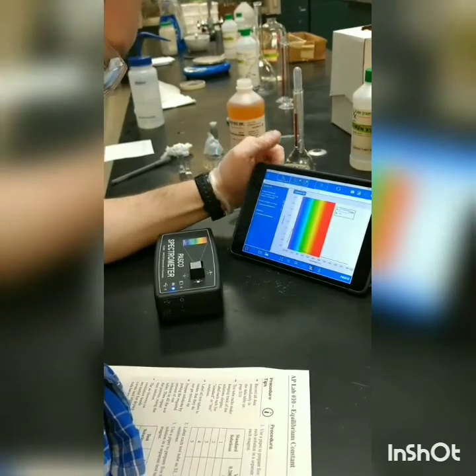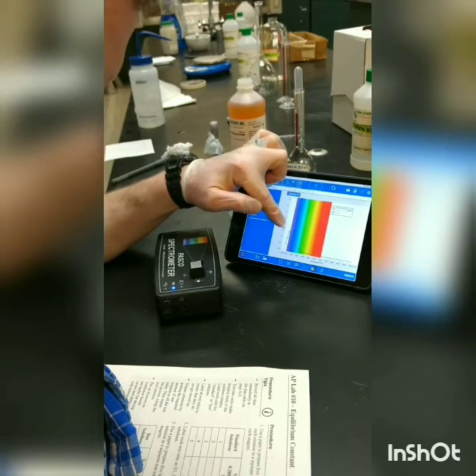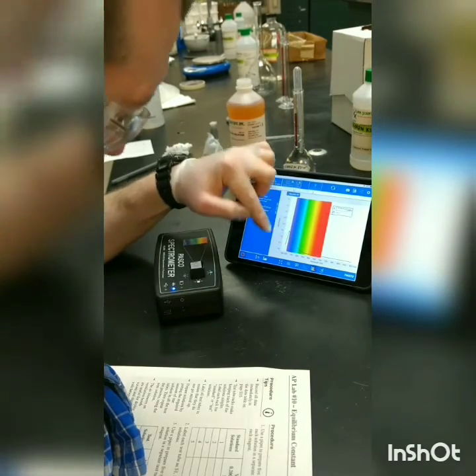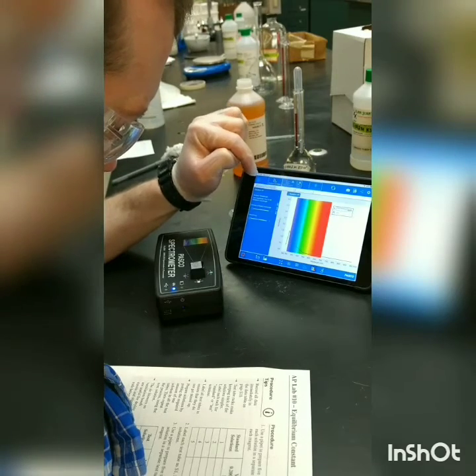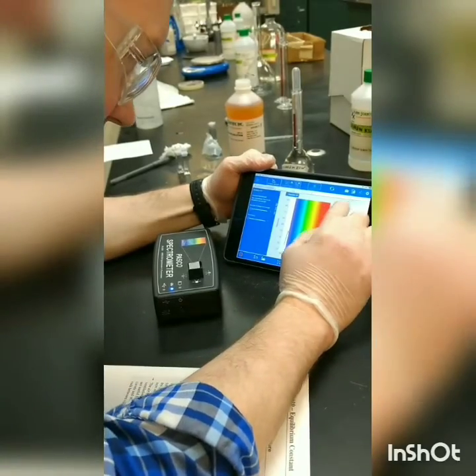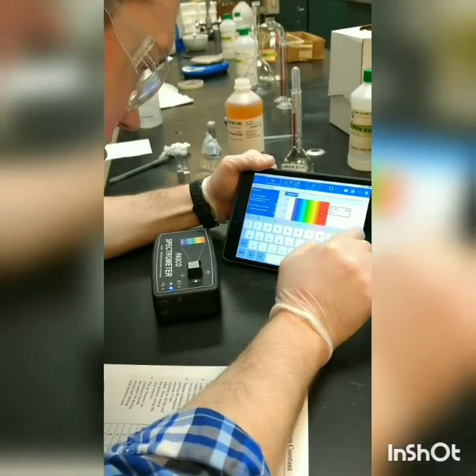All right, so you can see there, we get an absorbance curve. You'll notice that the peak is actually up here in the ultraviolet region, but we're going to use this, it's advising us to use the wavelength here at 450 nanometers. You'll notice that we still get pretty significant absorbance there at 450. Anything beyond that, the absorbance starts to go pretty far down. Okay, so we're going to tell this system that we want to use 450 nanometers.